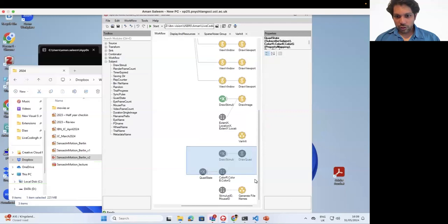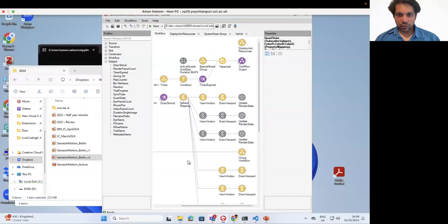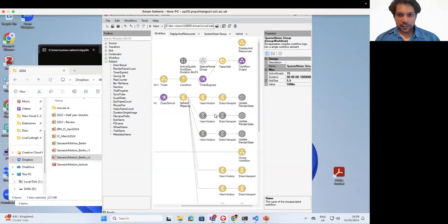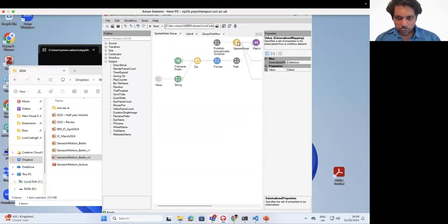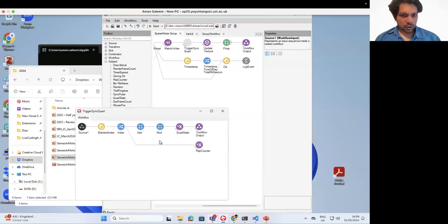Here we've got this one, which is quad state, which is the same as before. But what we've done instead is, every time there's a render frame, we are just getting the element index, and we're getting a render frame count. Actually, more than that, it's here, trigger sync quad.